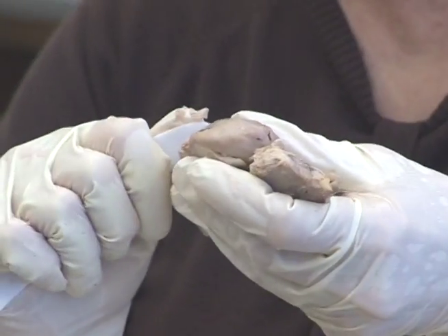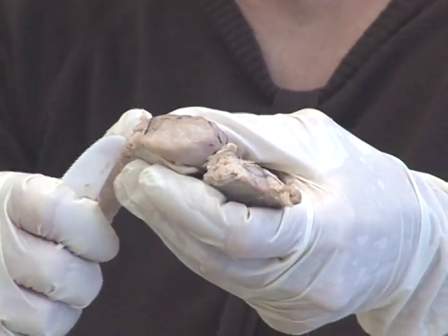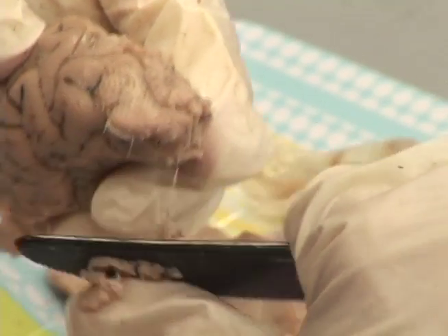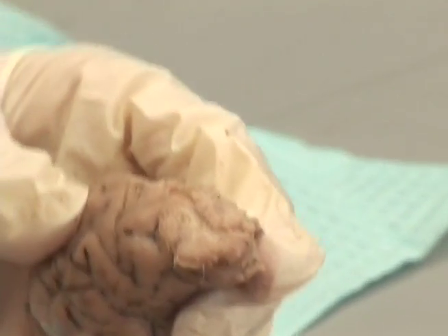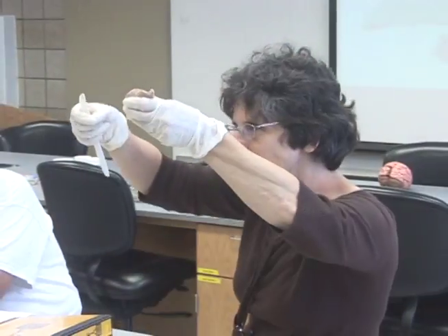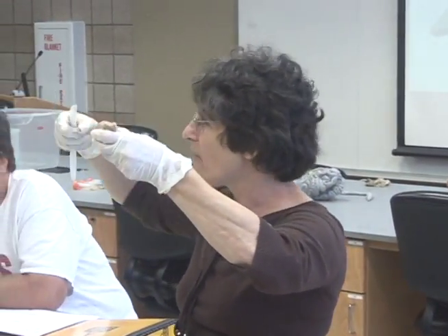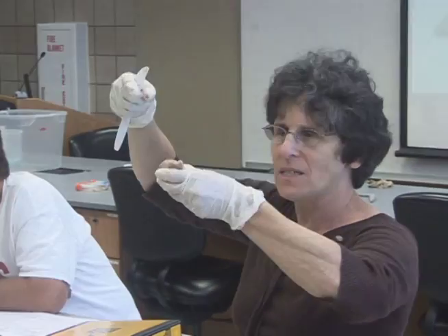Pull off some of those meninges on the surface. You can then begin to scrape off some gray matter of the cortex and get down to the underlying white matter. Scrape enough away that you can find the white matter fibers in the cortex, and then peel some of those fibers away and trace where they go — so you can see how they go between one bump of cortex to the next.